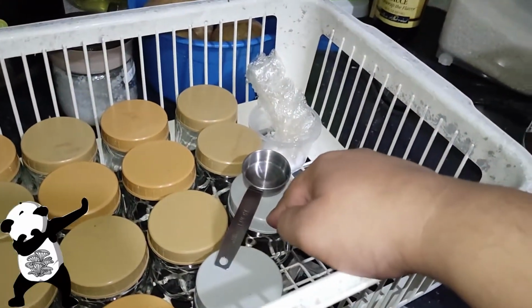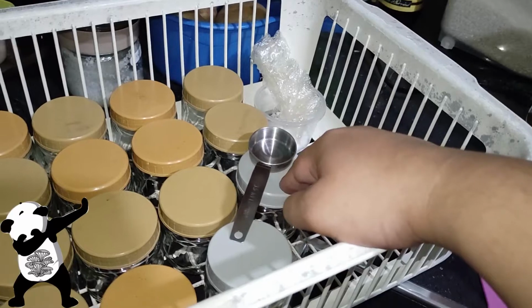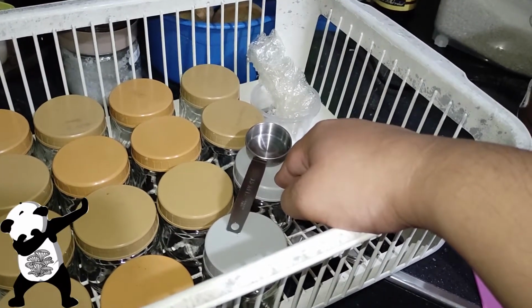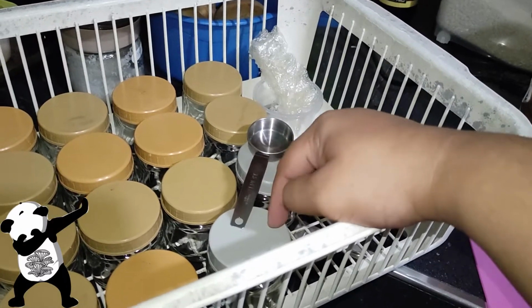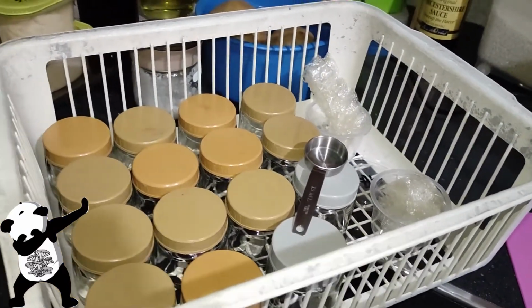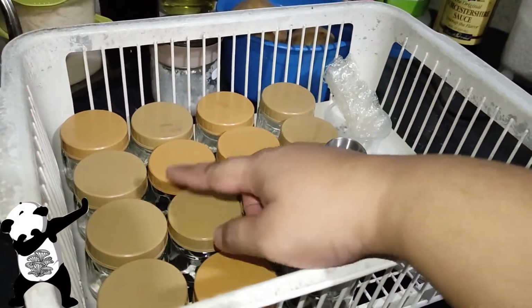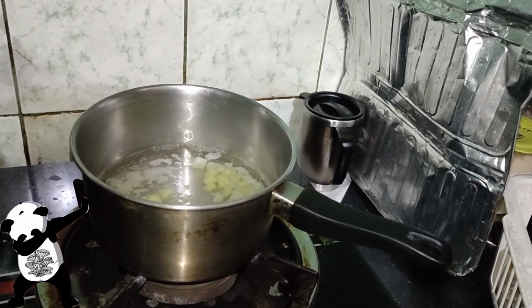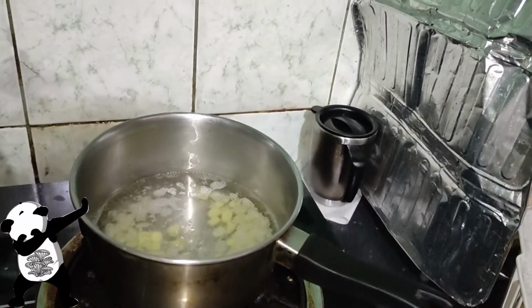But these two gray lids were not soaked in vinegar because these are new lids. I only soak those that I've used several times, which are the brown ones. So hopefully we're gonna have better results.